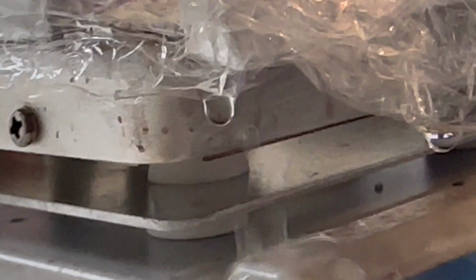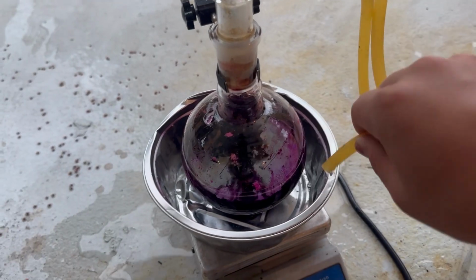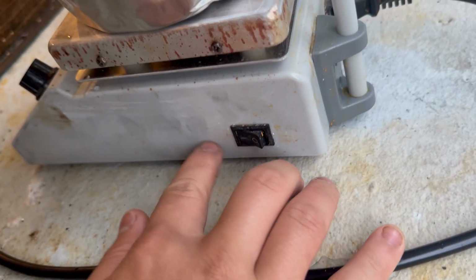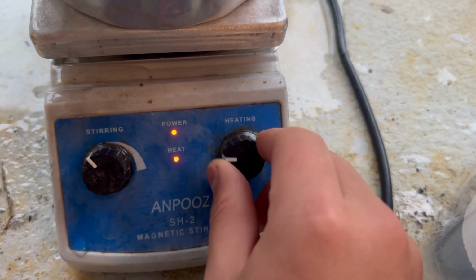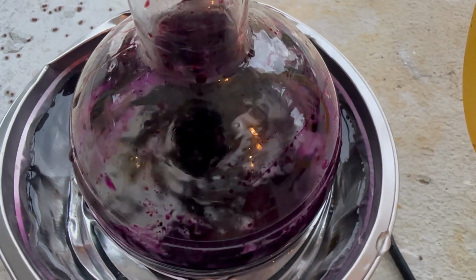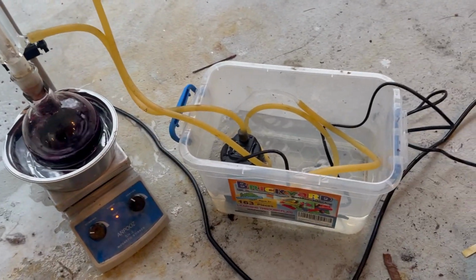Yep, it's leaking now. Look at that. Haven't even started, it's already leaking. This does not bode well. Fortunately, I found an alternative, which was this aluminum thing. Wait, I swear something's missing here. Oh shoot, the ice packs!